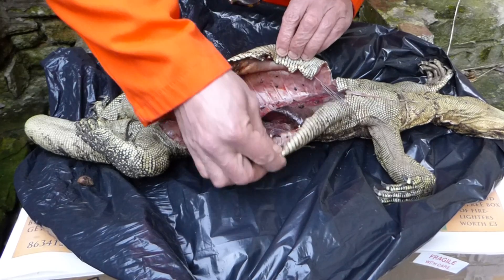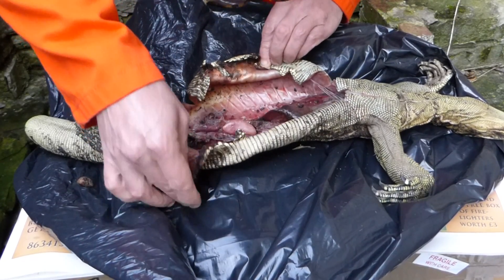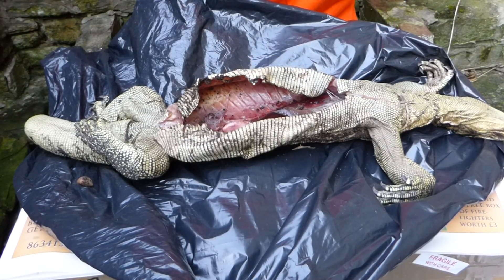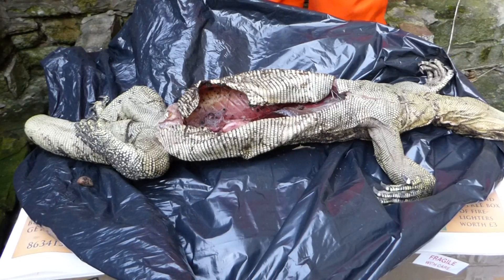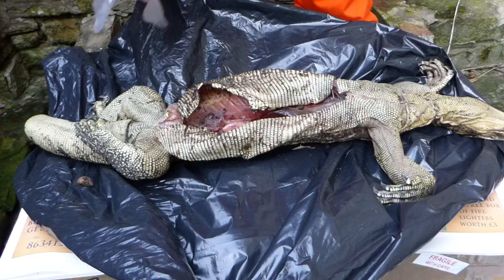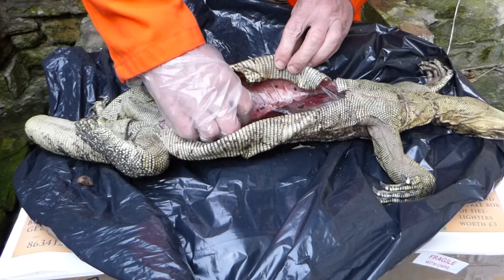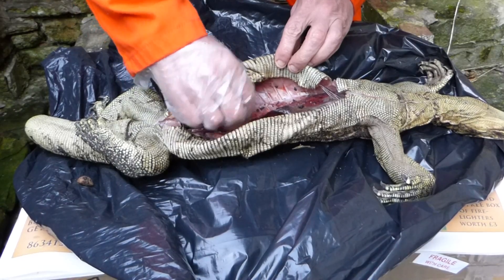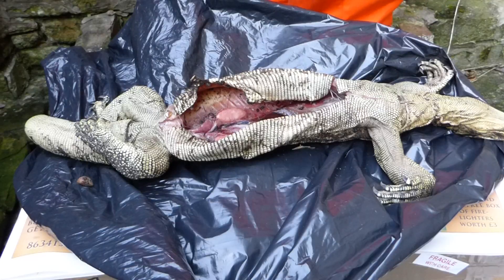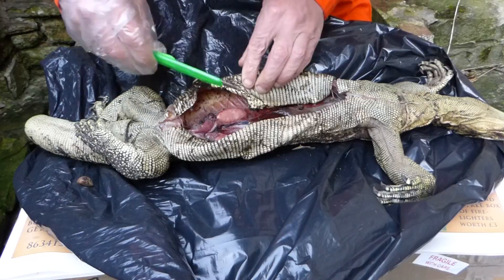Anyway, let's have a look what's inside here. So here's the male. Look at that. I've got to cook our kids' tea when she gets in, so I'm best to wear gloves. There's one there and there's one there. I hate these things — they scare the hell out of me.